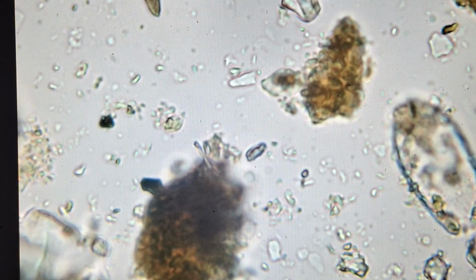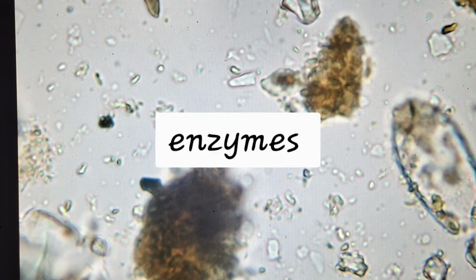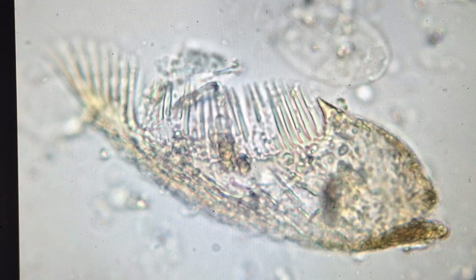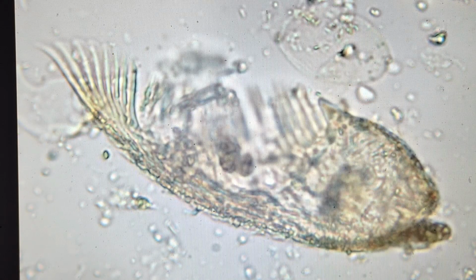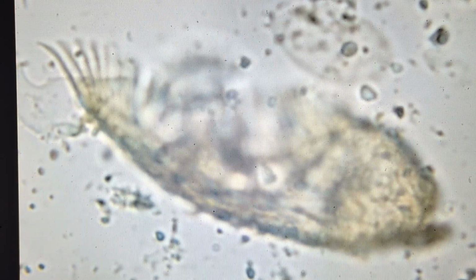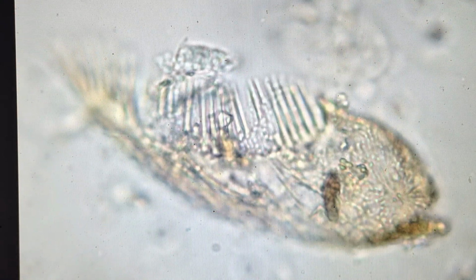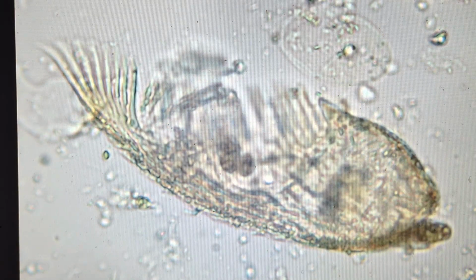Also look for some nice segmented fungi, some septa in it, some breaks in it. Then you find something like this that you have no idea what it is. This has a fish shape to it. Or if it's just a piece of organic matter being broken down. Oh, and we can even see another amoeba in the background there.